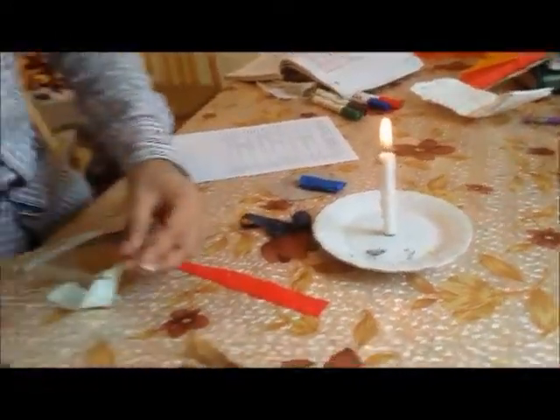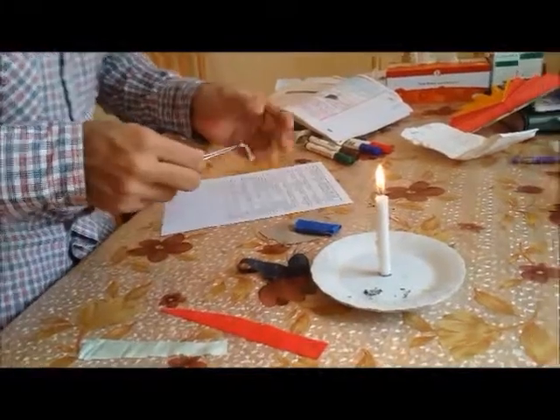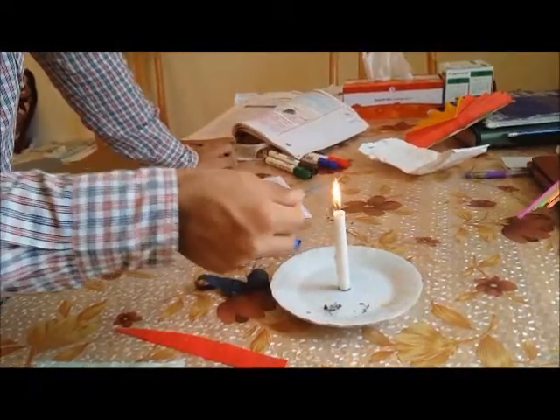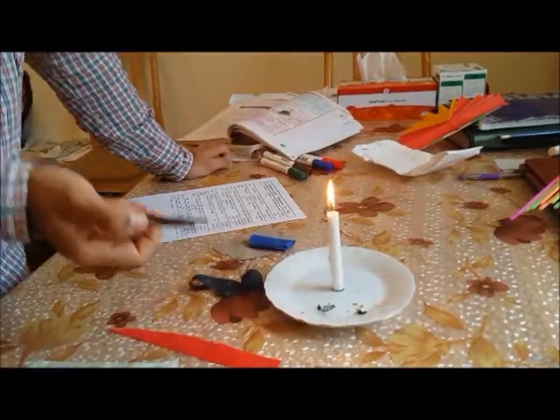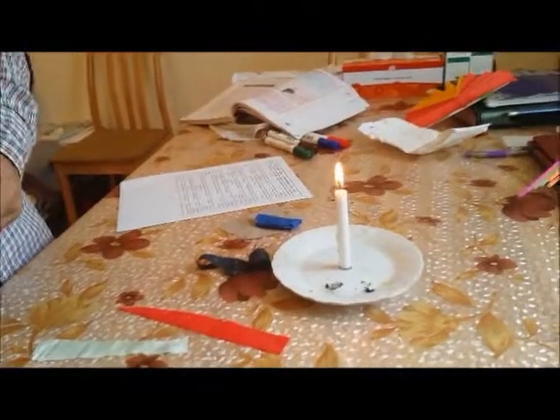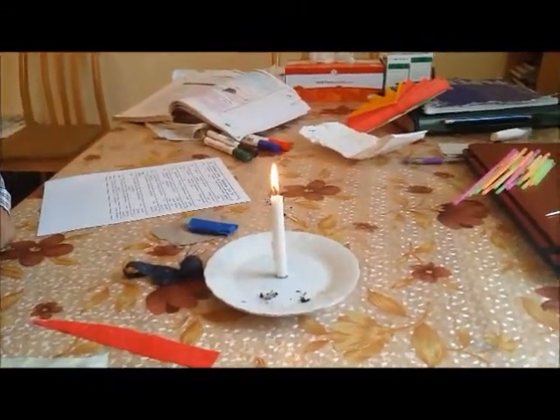Let me show you one more sample again. It burns with lots of difficulty — not completely. I need to bring it every time in front. It burns with difficulty. And the smell — the smell is just like a burning hair, the way how hair burns, like that.